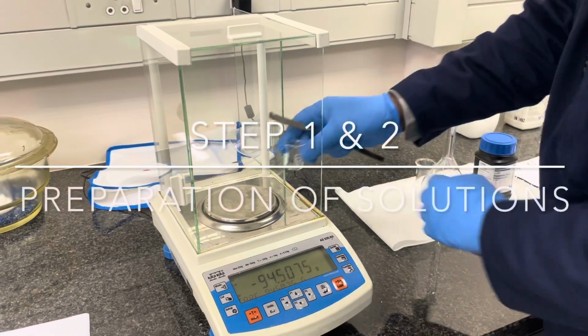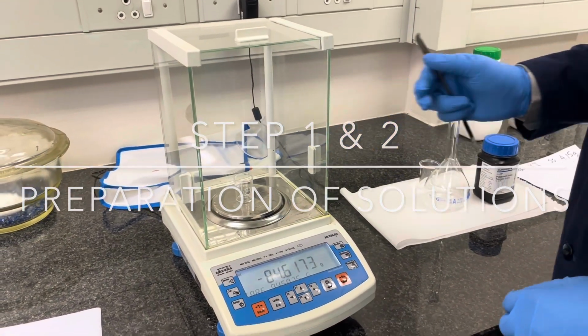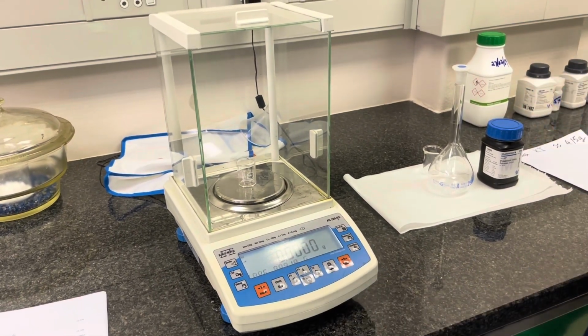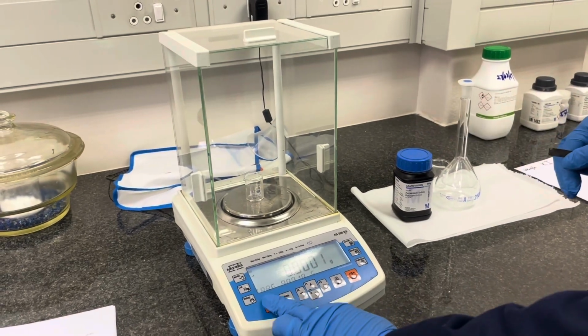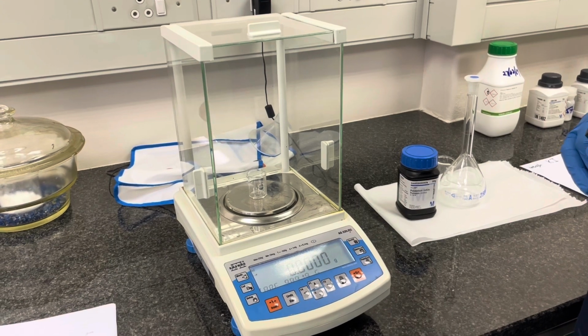The initial step in this experiment is to weigh your reagent masses as you have calculated before you come to the lab. As an example, we will do this for potassium iodide. Roughly 4.15 grams of potassium iodide needs to be weighed. We will do this in a small beaker.